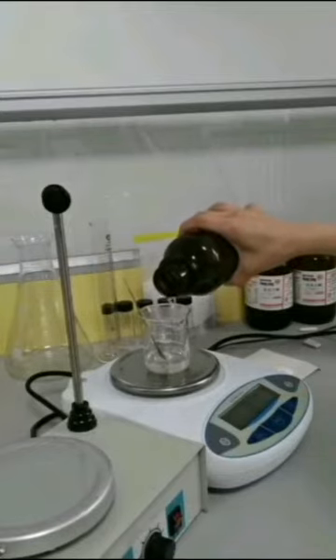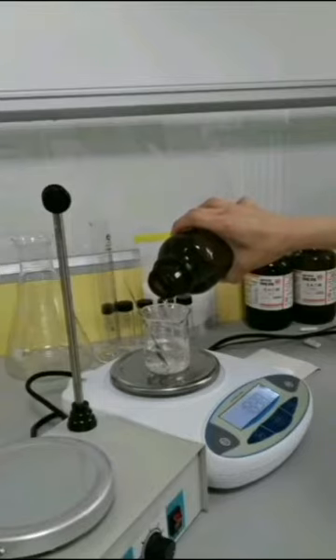To the transparent gel state, add 35 grams of alcohol in the third step and stir it slightly.